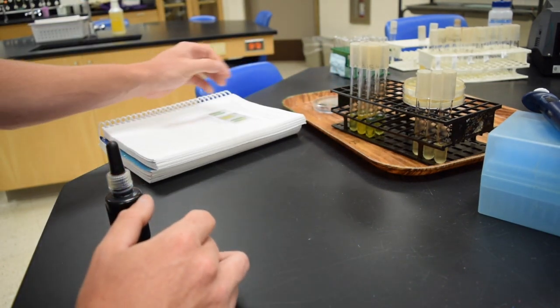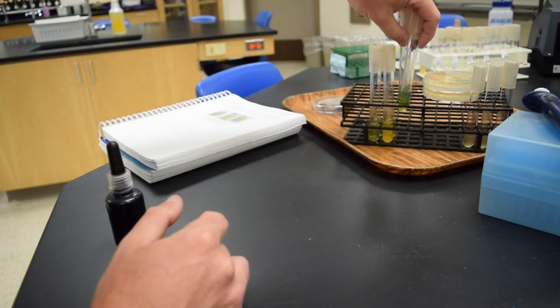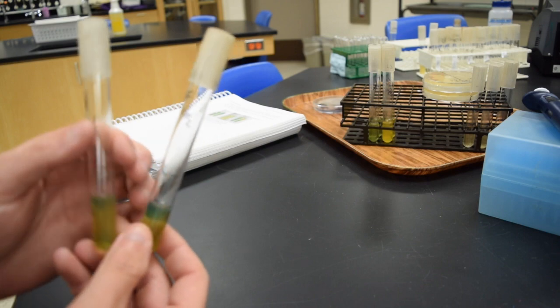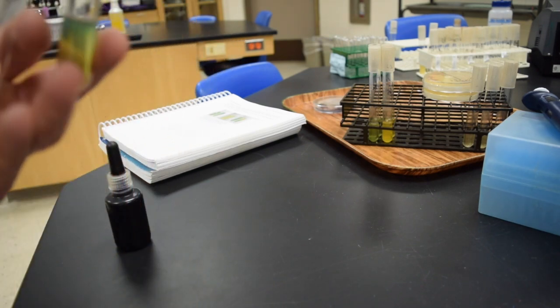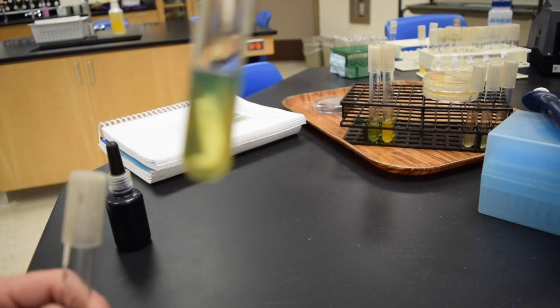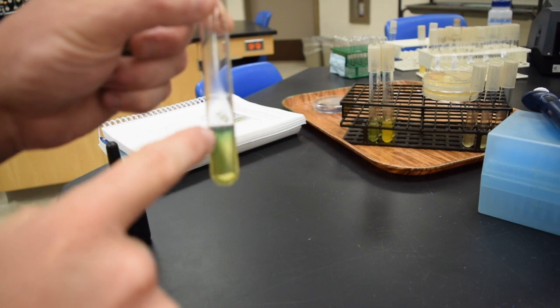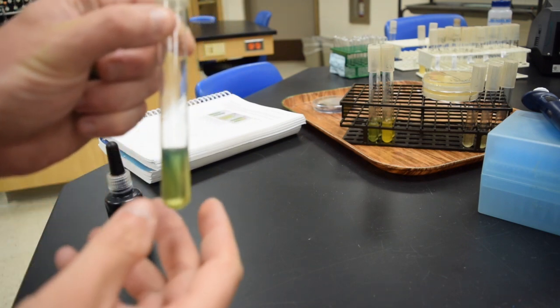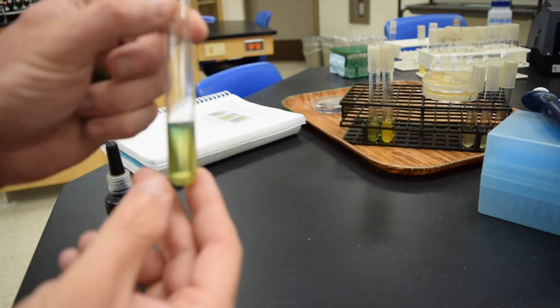Next part, part B, this is oxidation fermentation of glucose. So the OF media, this media was green to begin with, and I grew one with oxygen and one without. This is Alcaligenes faecalis, and again I will post still images of this. But this one has a blue kind of tint at the top, indicating something specific about this organism.